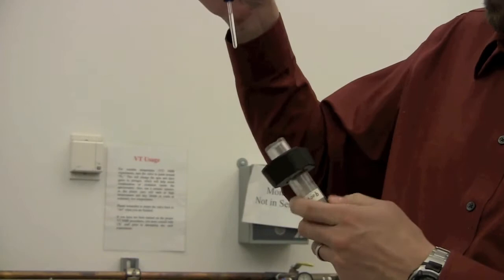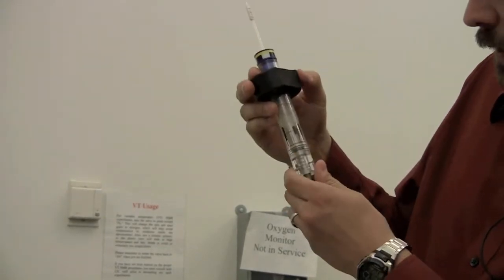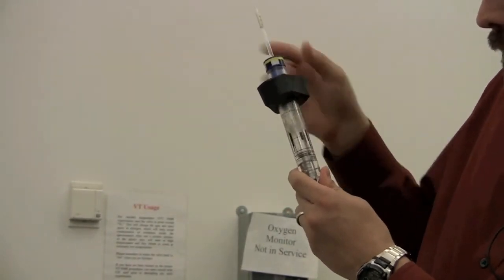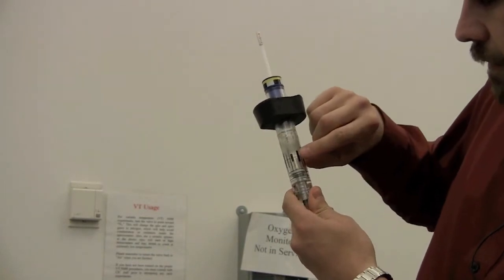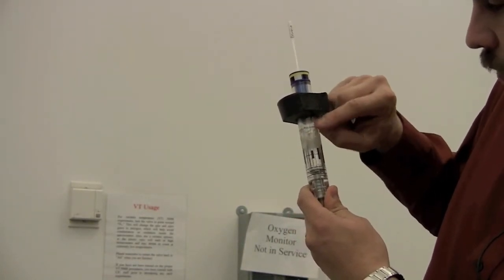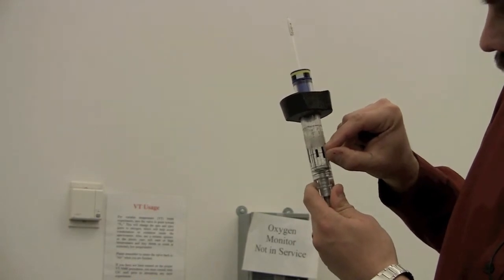You'll want to put it in the spinner, put the sample in the depth gauge, and push it down to the bottom. Now, if your sample is a little bit short, you may not want to push it all the way to the bottom, but rather center it on this center line right here. The reason for that is the only part of the sample that's being detected is this black bar here where it says receiver coil. It's a 5mm tube. This black bar here is the part of the sample that's actually being observed.